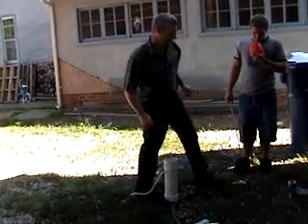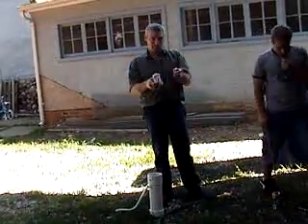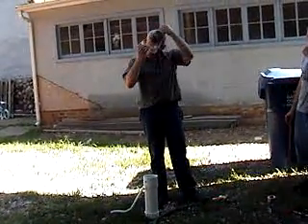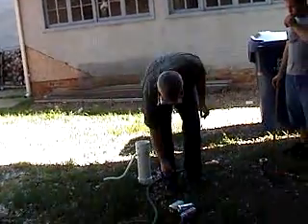I'm going to demonstrate how to make hydrogen gas. First of all, we use our personal protective equipment, which is goggles, because if you get this stuff in your eyes, you're probably blind. It's a very caustic solution.